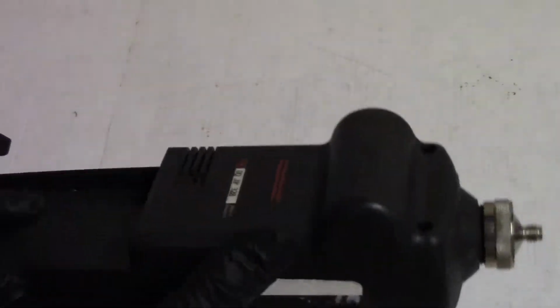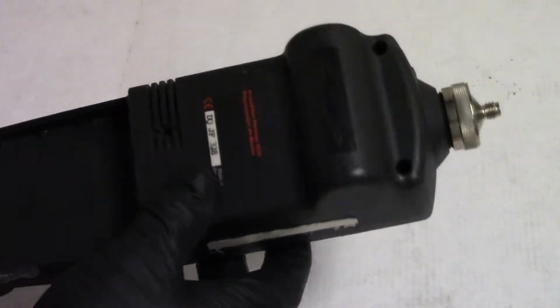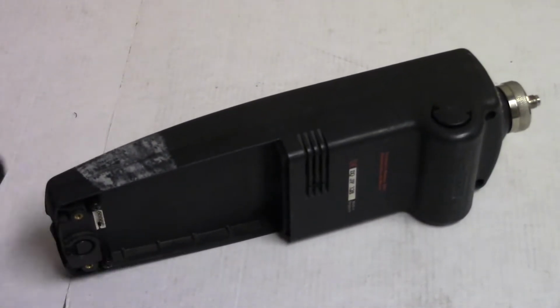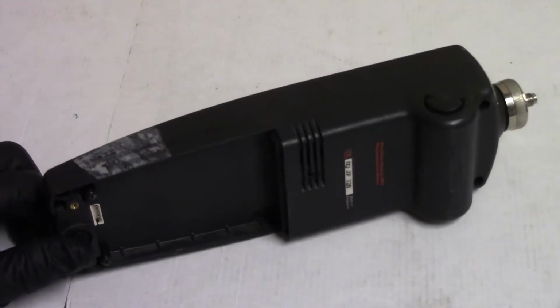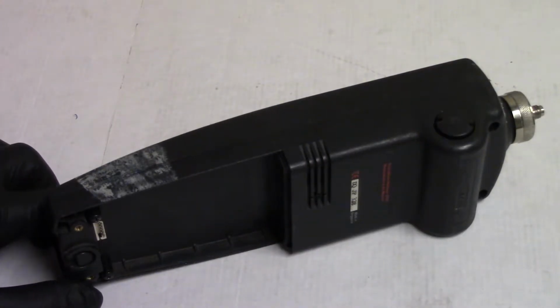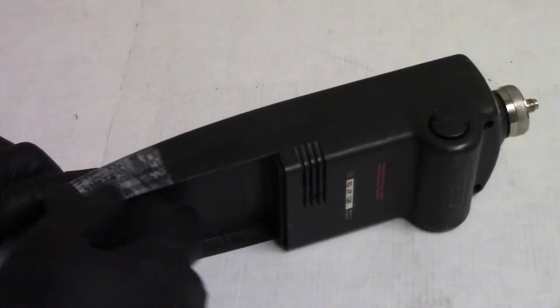I looked up the manual on it, and it's pretty cool. But let's go over the outsides before we start opening it up to really see what's going on inside. I do have a way to power it up, so we will be powering it up to see it do things. Hopefully some isopropyl alcohol is enough to trip the sensor.